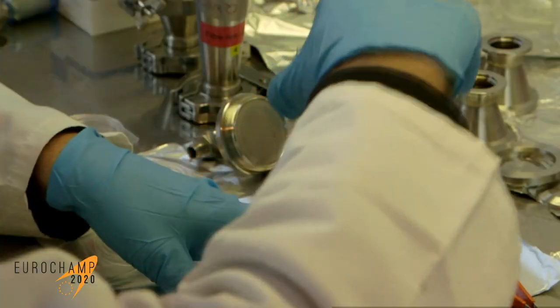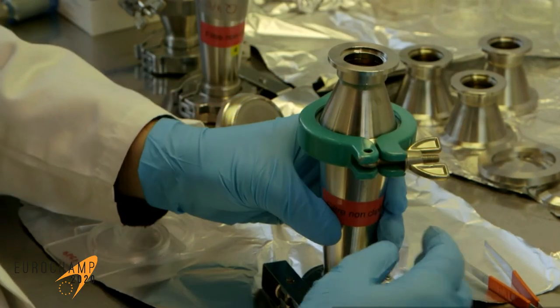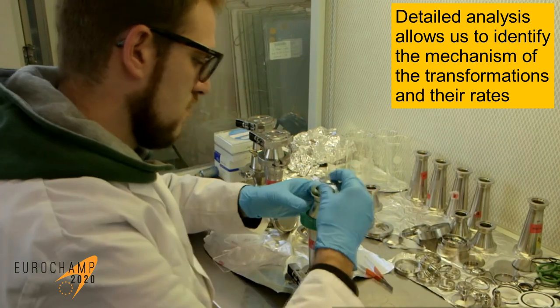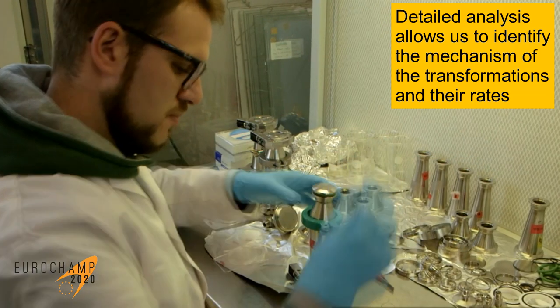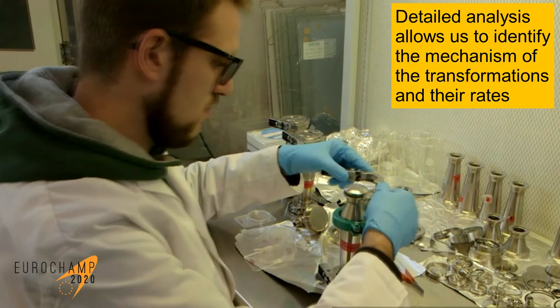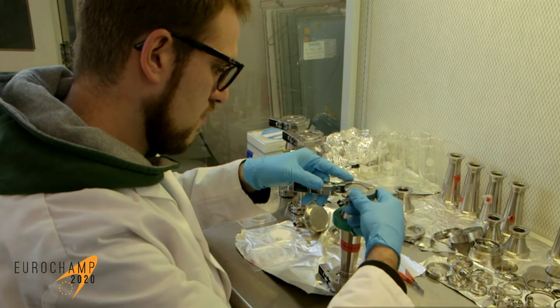Finally, in addition to the whole set of online measurements, this reacting mixture is collected on filters for further molecular analysis, which allows us to understand the precise mechanisms that have led to these transformations, and to later model them with computational methods.